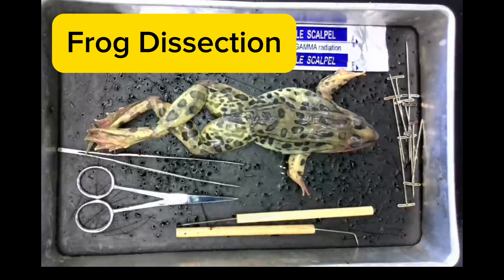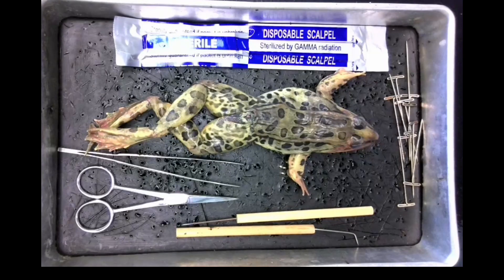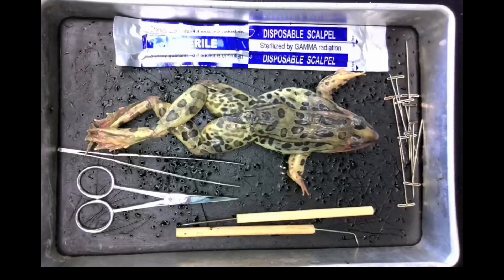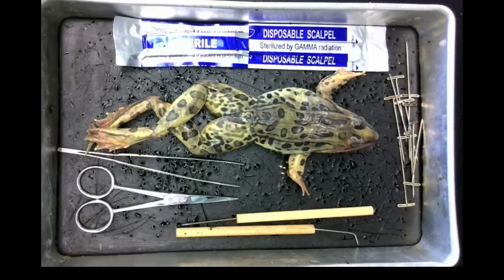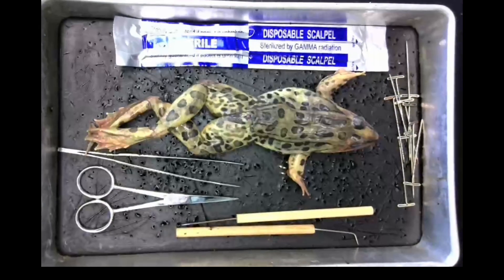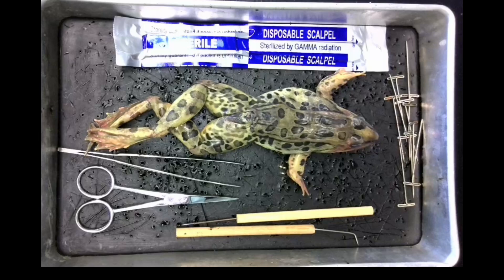Welcome to the frog dissection. Some background information on frogs: a newt and salamander are excellent examples of amphibians. They have mostly aquatic existence and have gills. The frog, on the other hand, is not an especially good representative of this class because it is quite well adapted to living on land. The advantage to studying the frog is that it is a good example of vertebrates, and its internal organs resemble those of more complex animals.